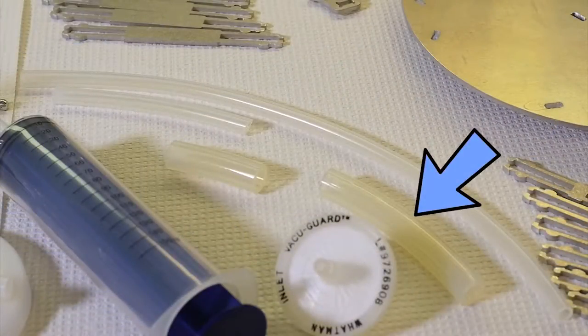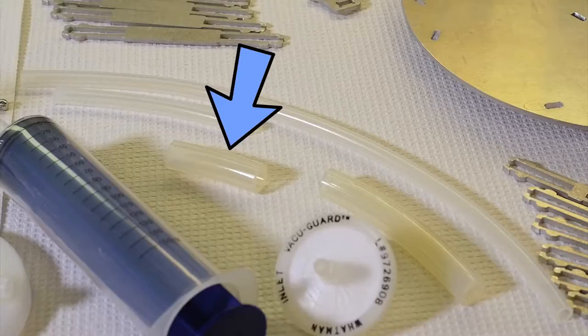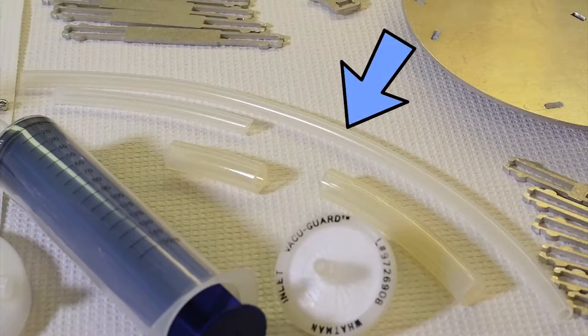Tubing components include short wide diameter tubing for eluent injection, very short wide diameter tubing for connecting the filter to the collection cup, short small diameter tubing for the filter air vent, and long small diameter tubing for the collection cup outlet.